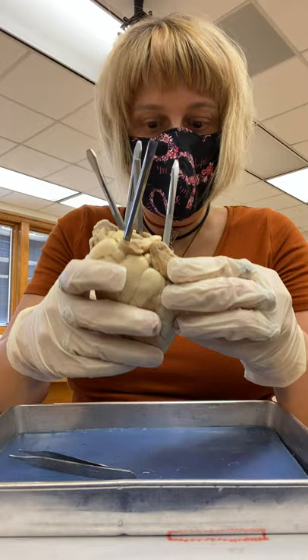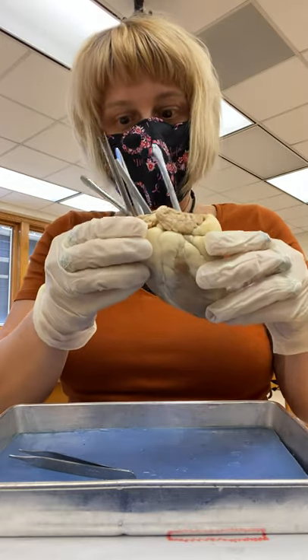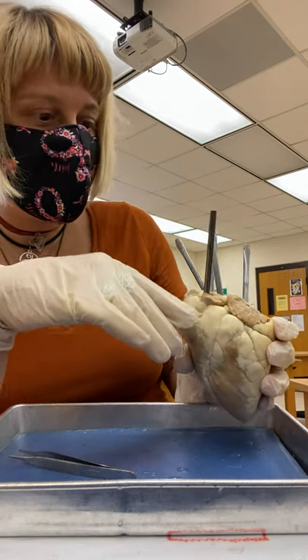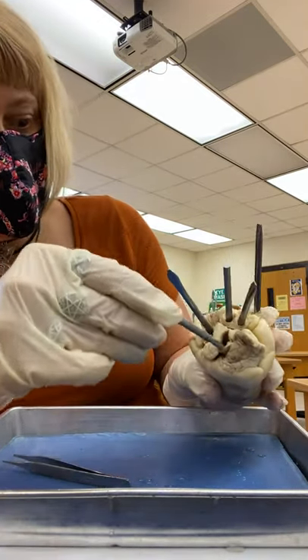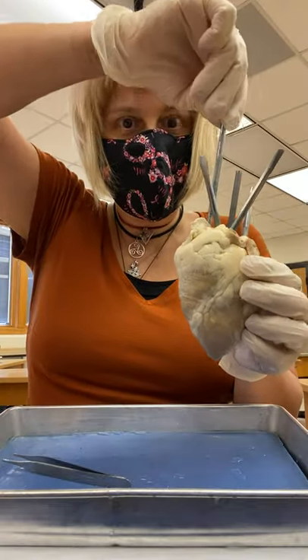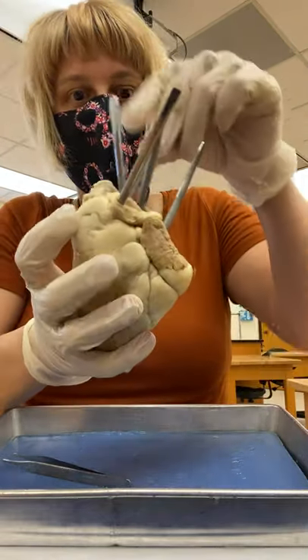Now let's take a peek at the vessels. We've already identified that this side is the right and this side is the left. We need to be able to identify the great vessels and where they are. The first thing is to identify the right auricle. You can see this big hole — that's your superior vena cava. I can feel it as I penetrate because it's way open. It goes right into that right atrium, which is deep in here.